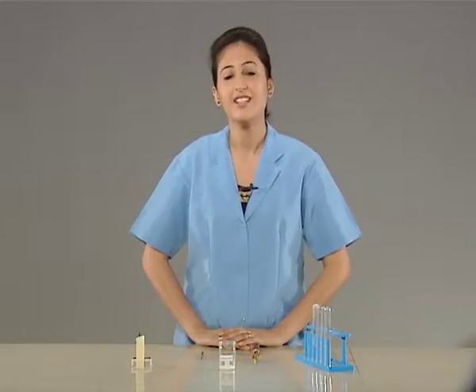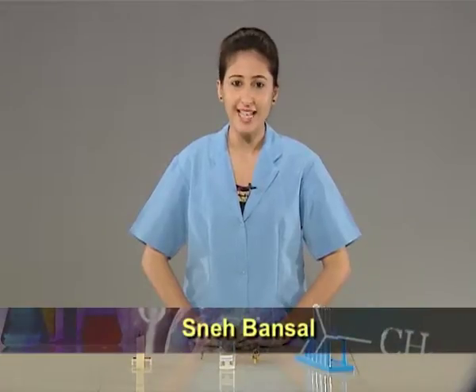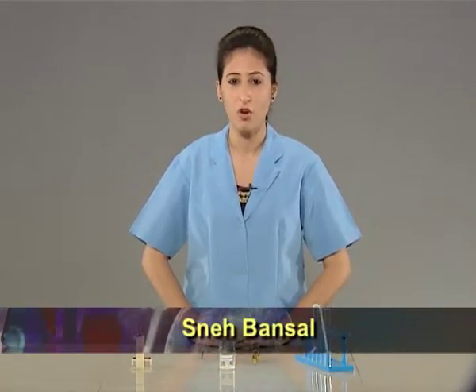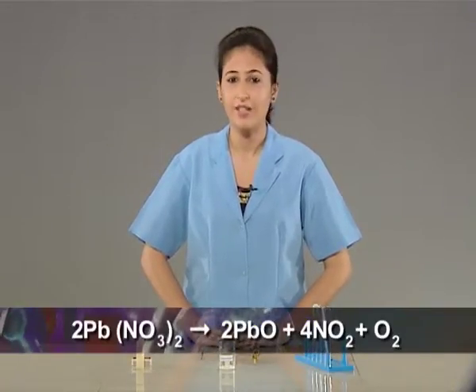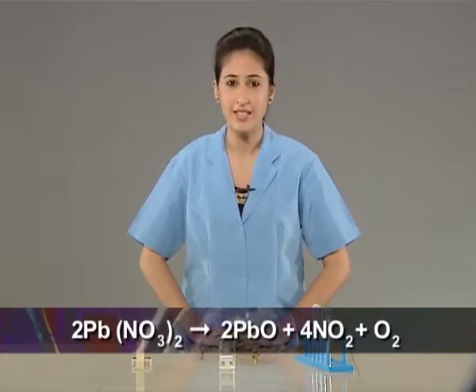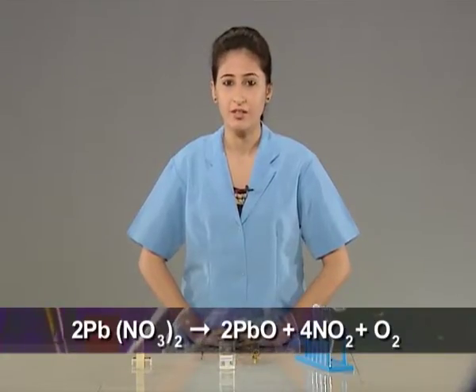Today, let us study the heating of lead nitrate in air. On heating, lead nitrate dissociates to form lead oxide, nitrogen dioxide and oxygen.